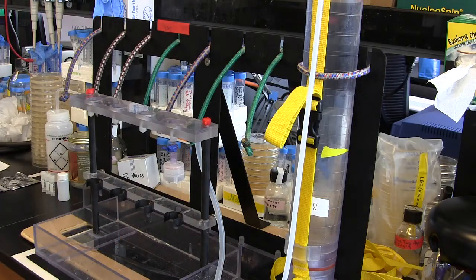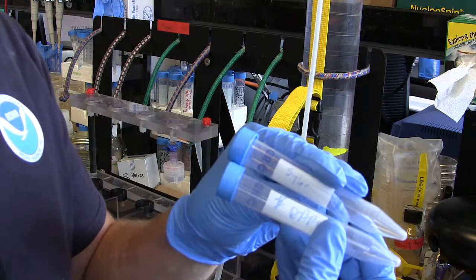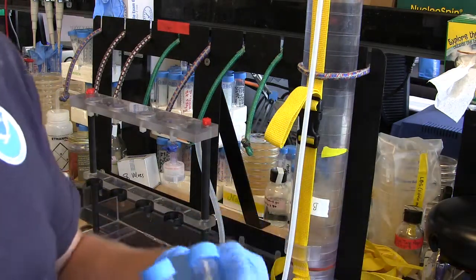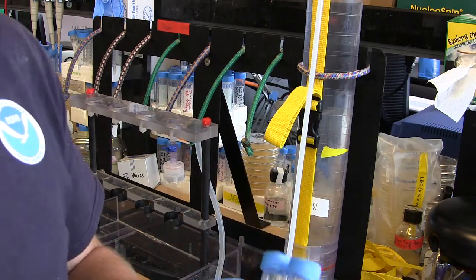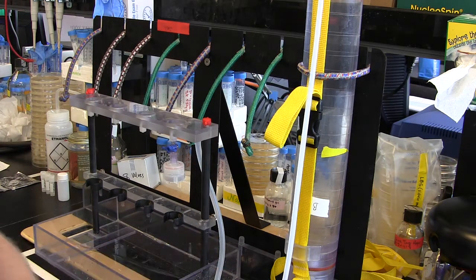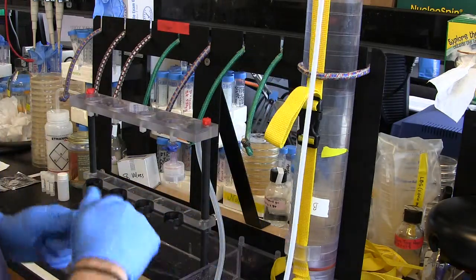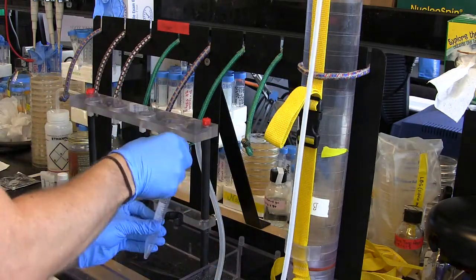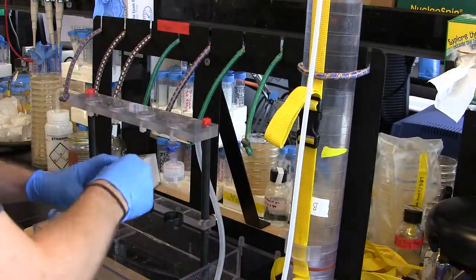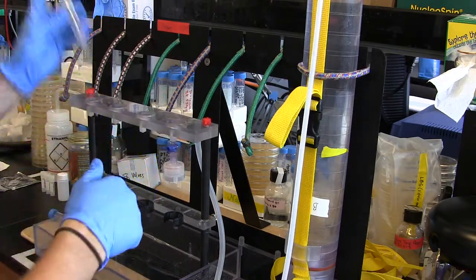What I want to do now is collect my water for my slides. Slide water is collected without any filtration at all. I have two Falcon tubes — 15 ml Falcons — one labeled SYBR, one labeled DAPI. We often reuse these on cruises so we don't burn through consumables. I want to triple rinse them quickly, then fill to 2 mils. For the triple rinse, throw a mil or two in, put the cap on, and shake — not vigorously, just enough to rinse out the inside.